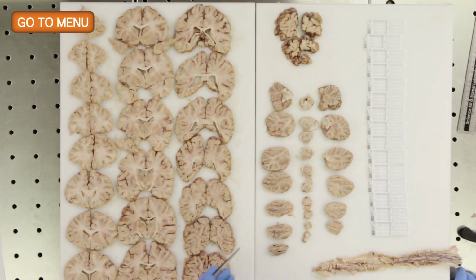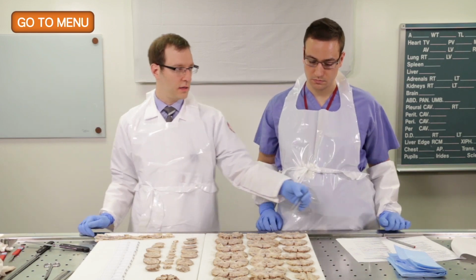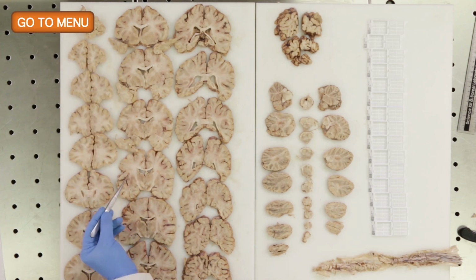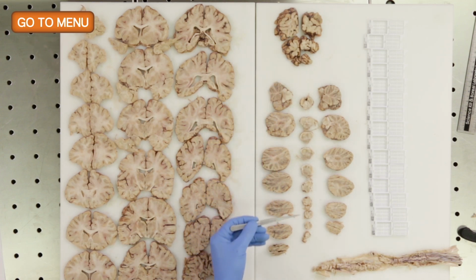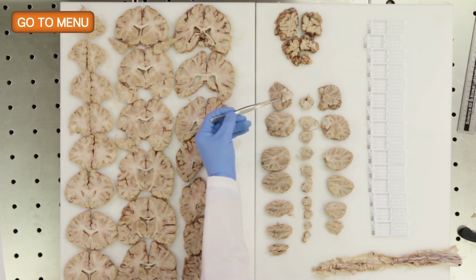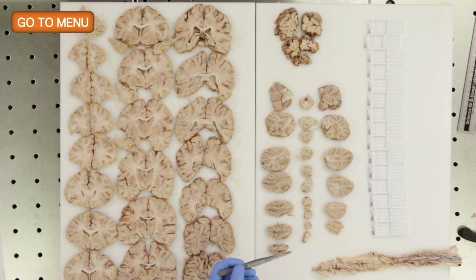Okay, so now we've laid out the brain. We've rearranged some of the sections to make it make sense anatomically. So here we have the anterior aspect of the brain and moving posteriorly like this in columns. And again, always the left is on the left and the right is on the right. So this would be the occipital pole. And then here in this area we have the left half of the cerebellum, the right half of the cerebellum. Again, cut sagittally, and then down the middle we have axial cuts through the brainstem.